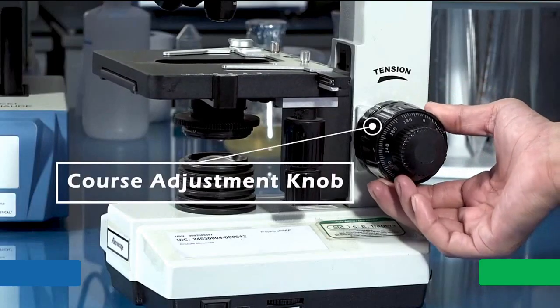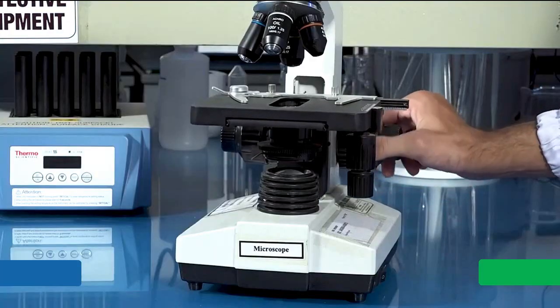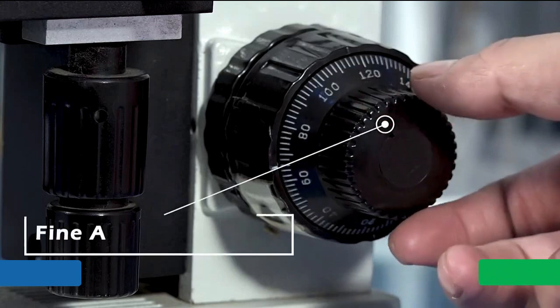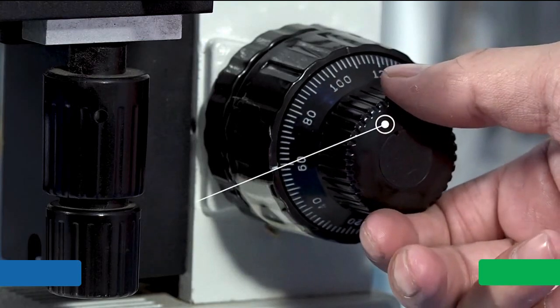The microscope stage can be moved up and down using the coarse adjustment. Once the slide is focused using coarse adjustment, fine focus is used to further improve the resolution of the specimen.